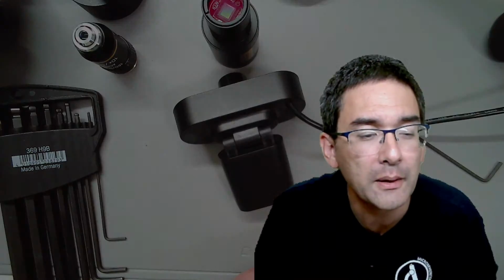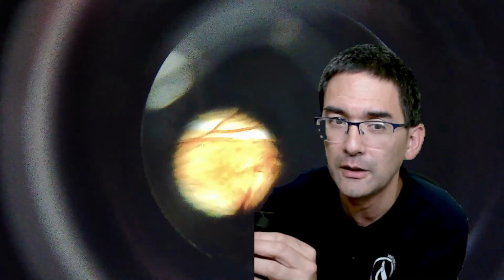I'll just show you a webcam. Here is the webcam. I hope that you're able to see this. And look, if you hold the webcam, of course, it's afocal photography in front of you, so you have to get the distance correct, okay? And then you're also able to see this. Now let's go down a little bit with the magnification. So that is essentially one possibility.